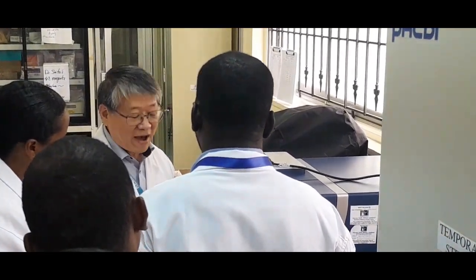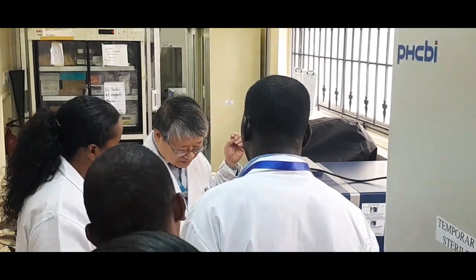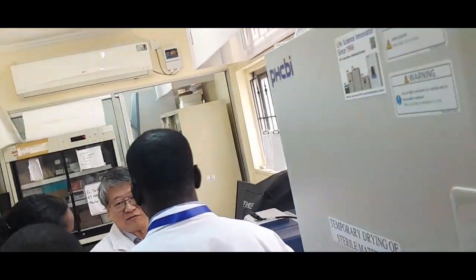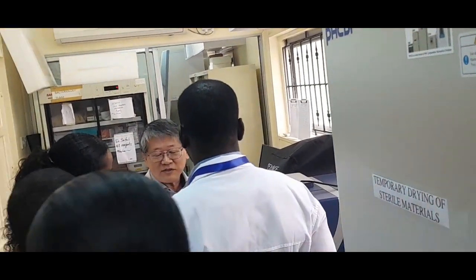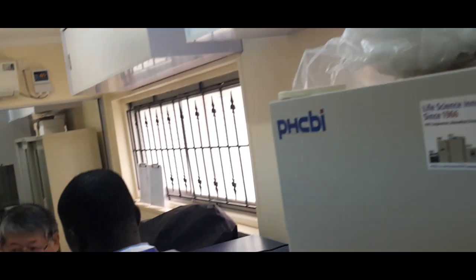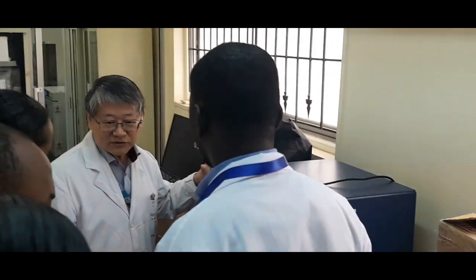Okay, so just to check, for example, how much some compound gives damage to the cells. How many cells are alive, how many cells died. So the safety of the compound we can check by MTS. So in that case we use this.